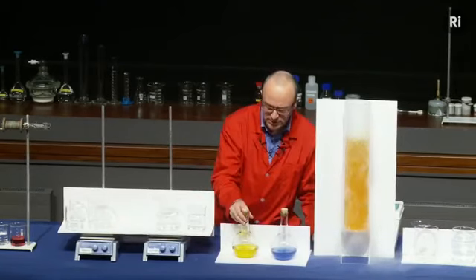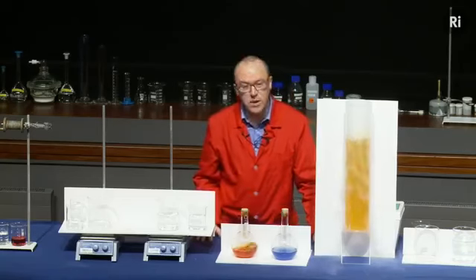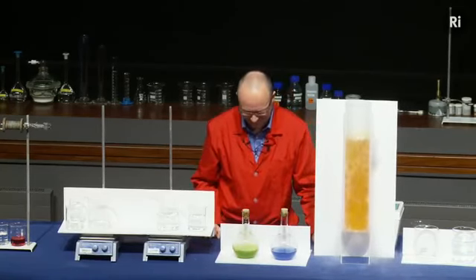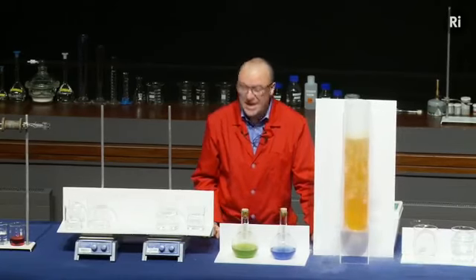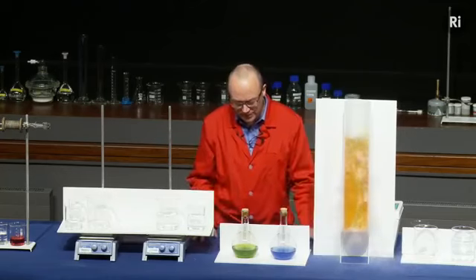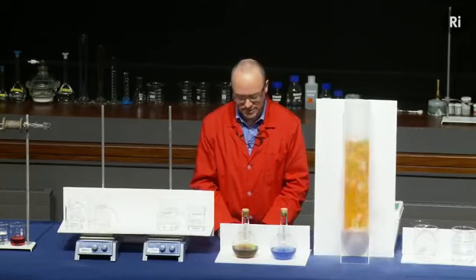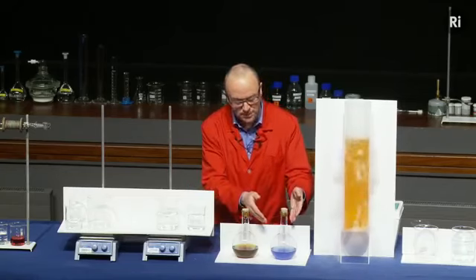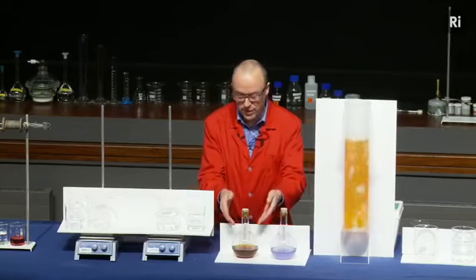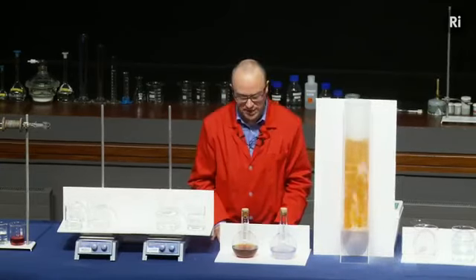Here's another flask. It's a similar idea. This is a yellow liquid. If I shake it, it turns red. And if I gave it a really good shake, it turns green. Now, something else rather surprising about this as well. If we keep watching, the green is turning back to red. And if we look here, the blue is turning back to being colourless. And in fact, the red will go back to being yellow.